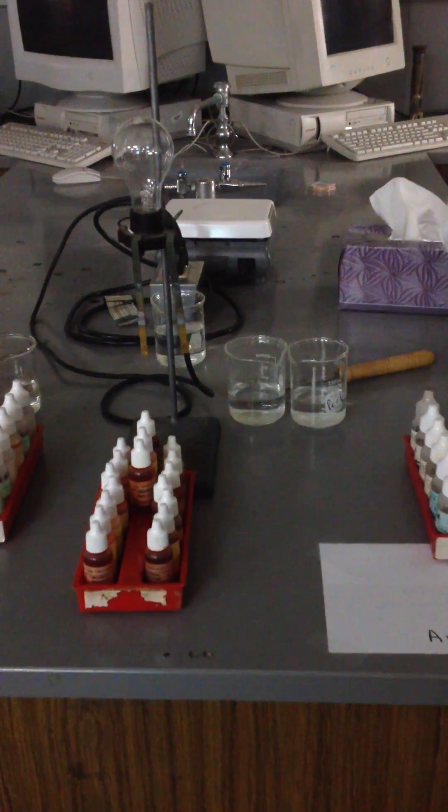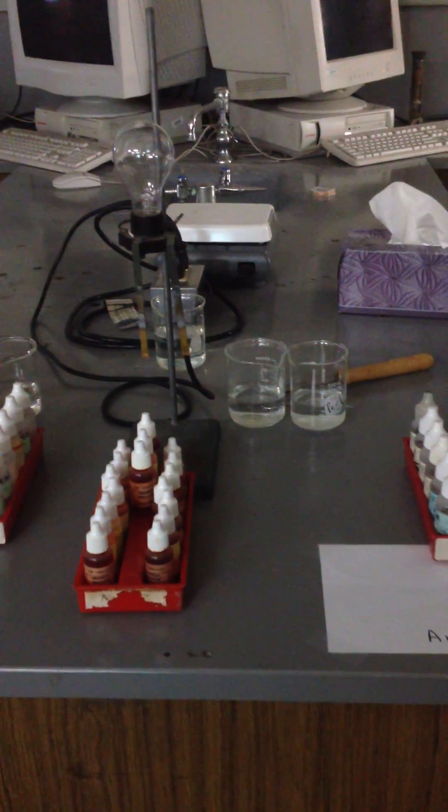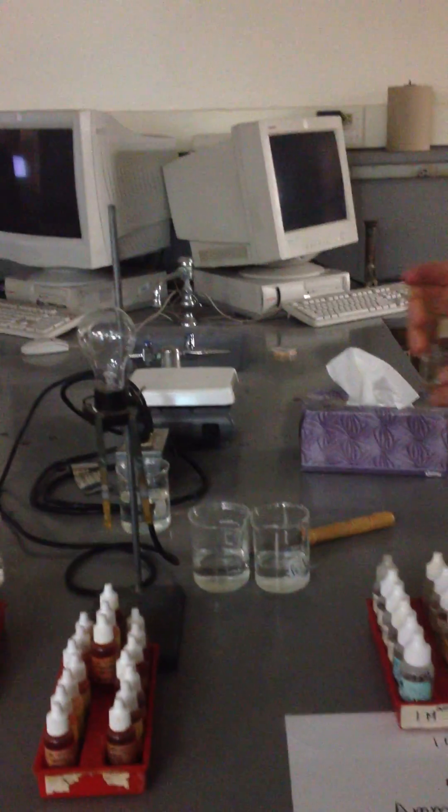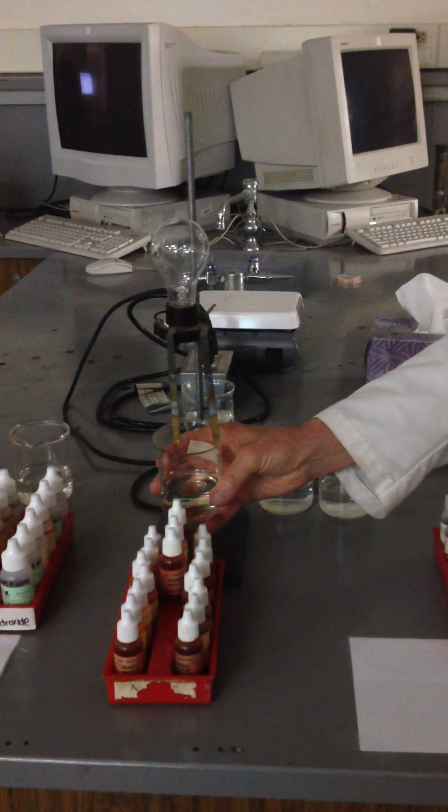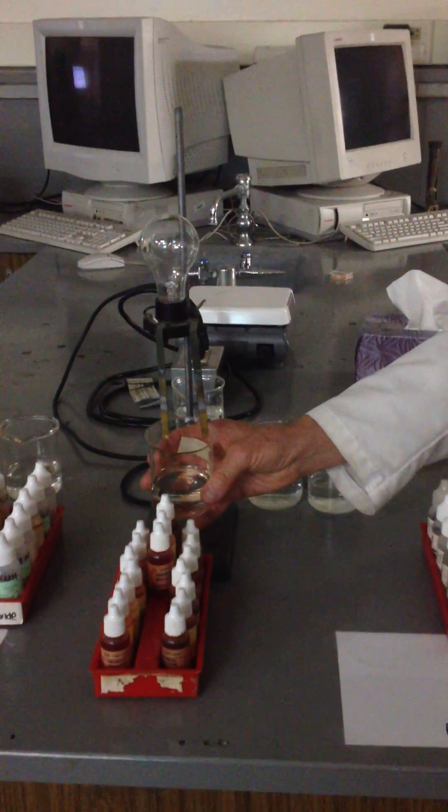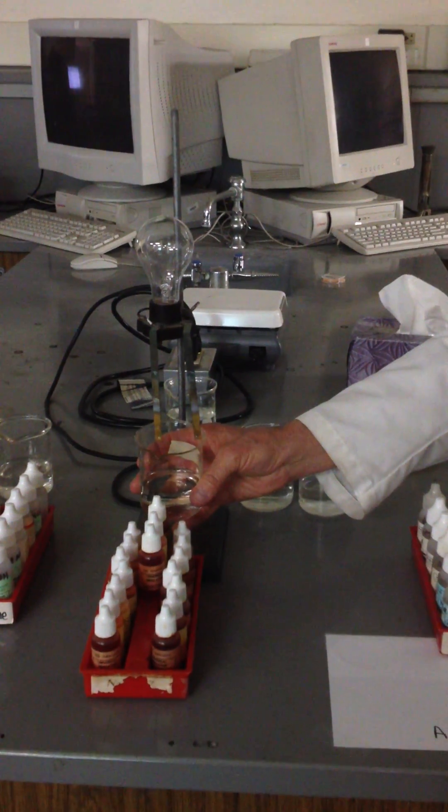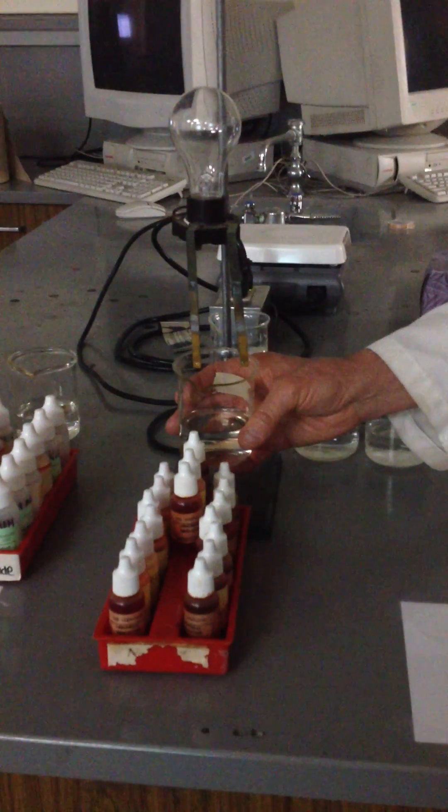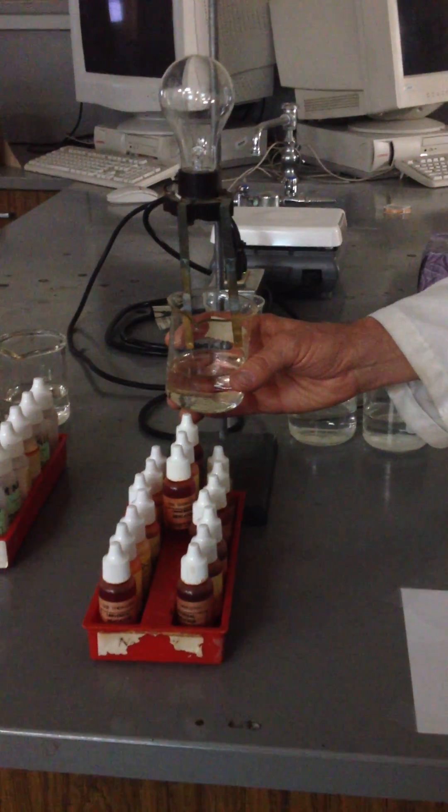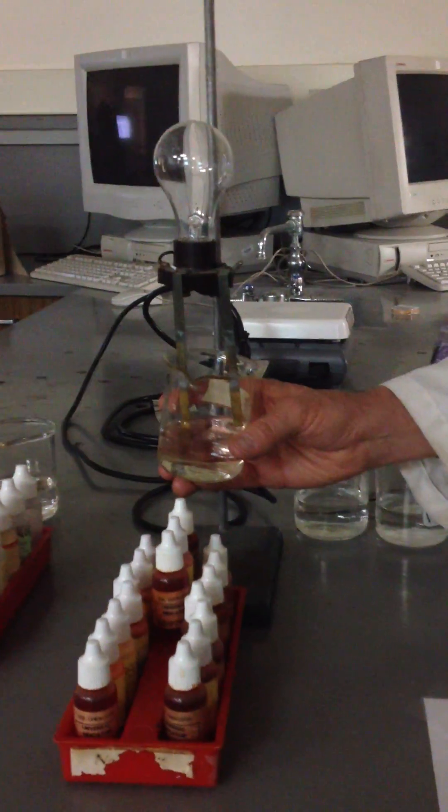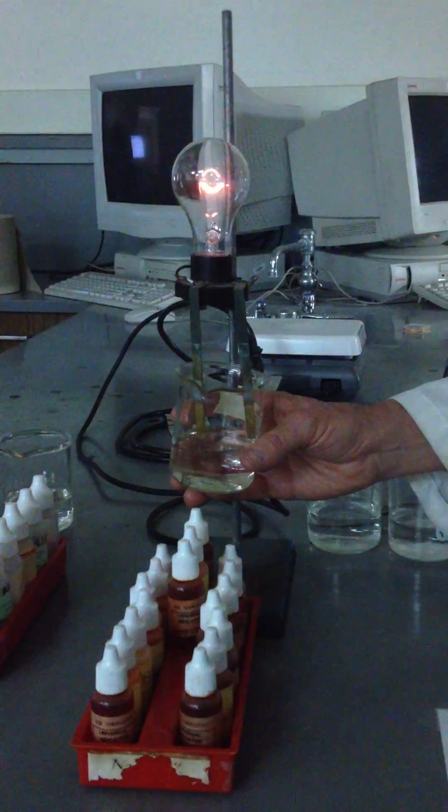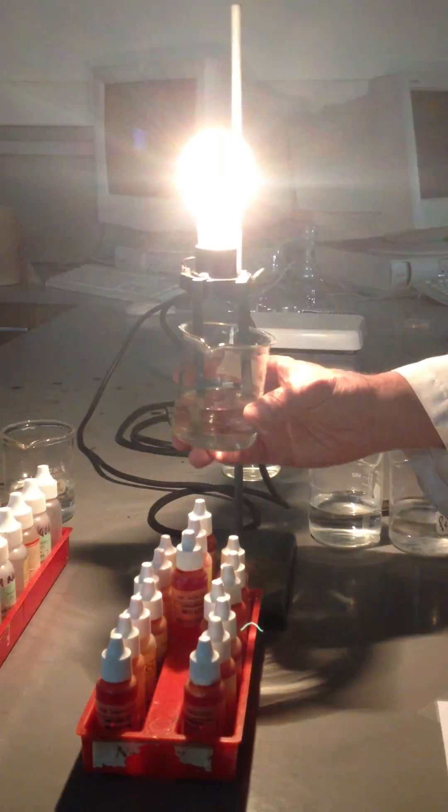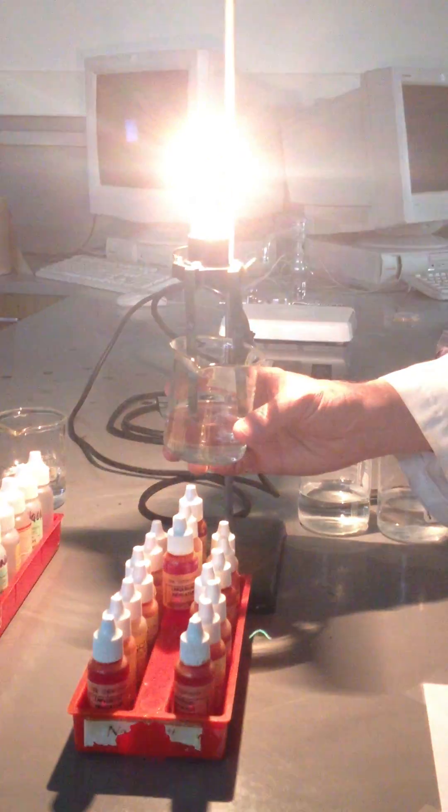Now, what's the first thing I'm supposed to test? Hydrochloric acid. I have a beaker here with hydrochloric acid in it. What is your prediction? Is hydrochloric strong or weak? Strong. Which means it ionizes how much? 100%. Now I'm just going to barely touch the water to the electrodes, just a little bit. It's pretty hard to not have it conduct and get as bright as that baby will go. Notice it does dim down a little bit as I get more shallow.